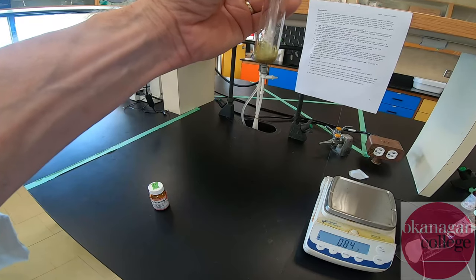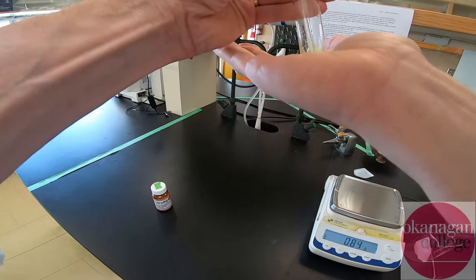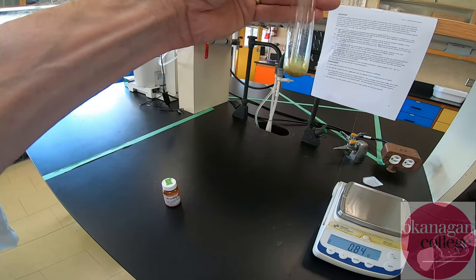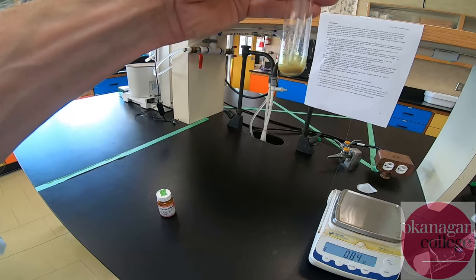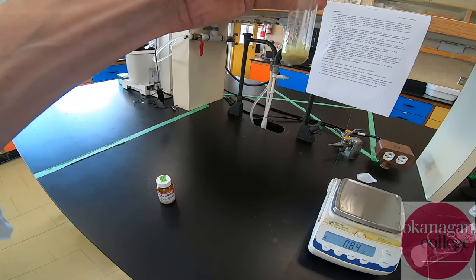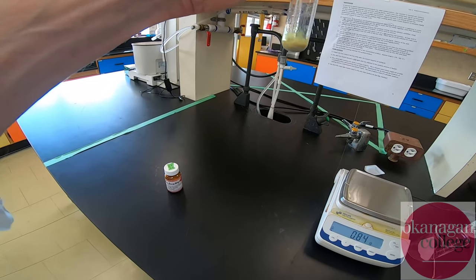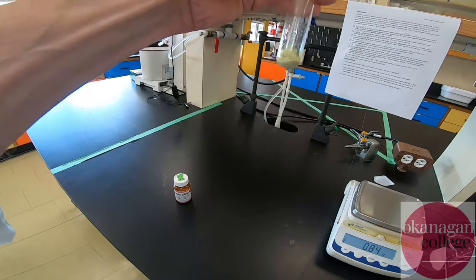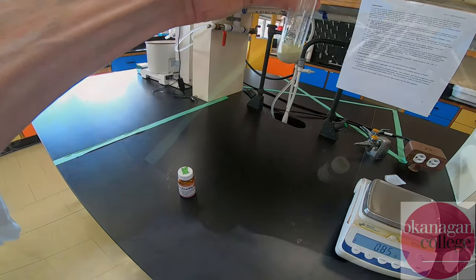We're about three or four minutes in. You can see that the solution is starting to become murky and is starting to warm to the touch — the reaction has started to go. The murkiness is really starting to develop now, and that is the production of the large final product molecule. I'm going to try to keep this moving as best I can, because if I don't, you get a very solid plug of material that is very difficult to work with.